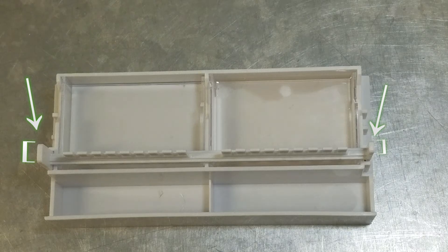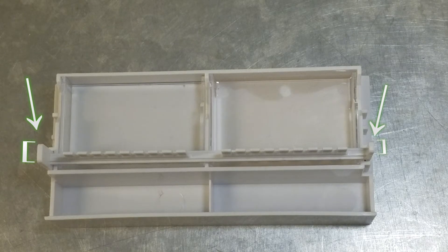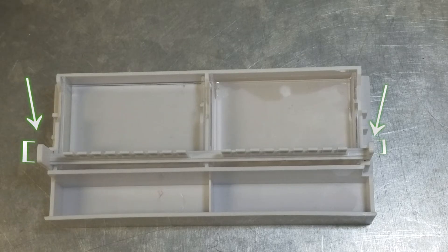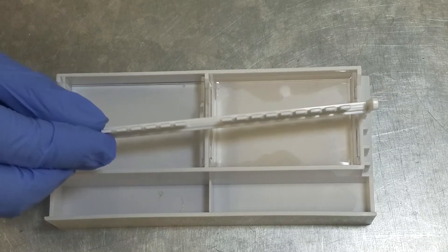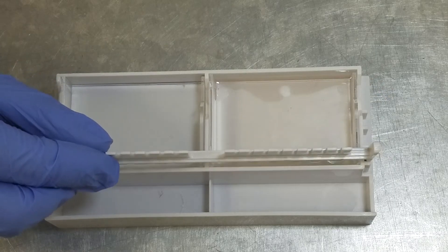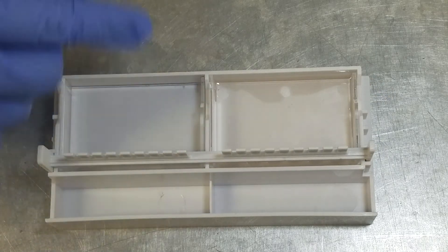Notice one side of the combs is much wider than the other side, and it corresponds to the spaces in the casting stand. The combs can only fit in one orientation. Again, it should not be forced, and check that the comb is straight and flat across the top.